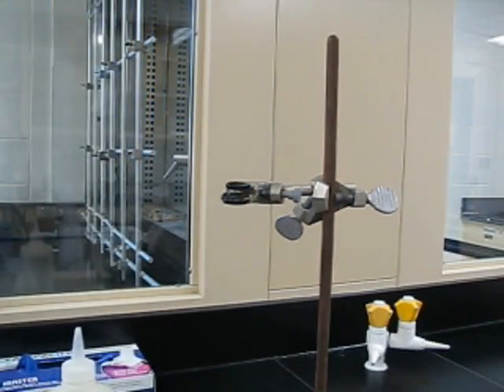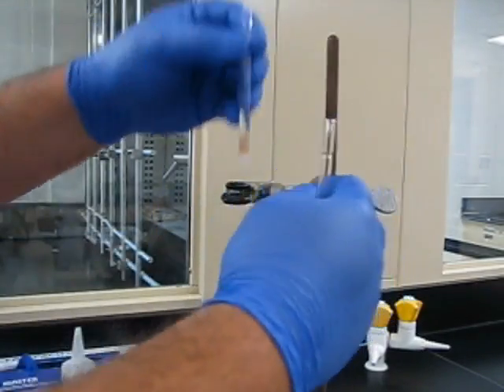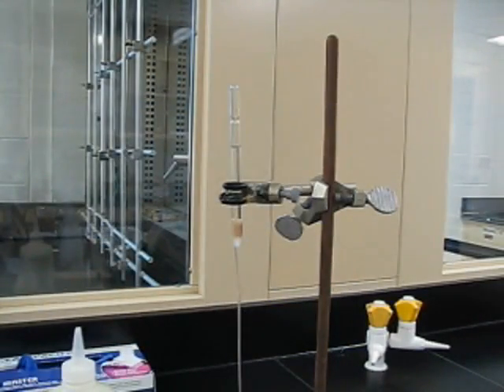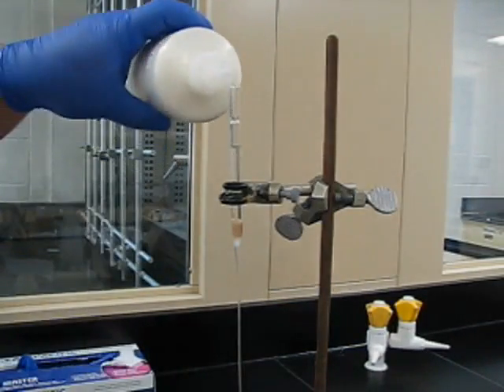Now, in the video here, I've got way more sand than is actually necessary. The only purpose of the sand is to keep the silica gel flat. So it's definitely more than necessary here.